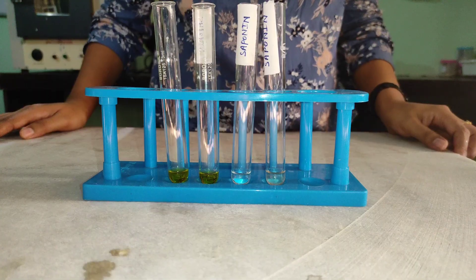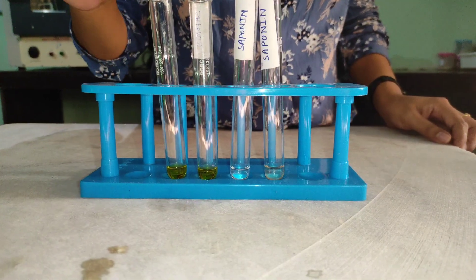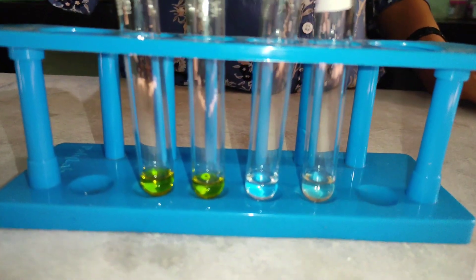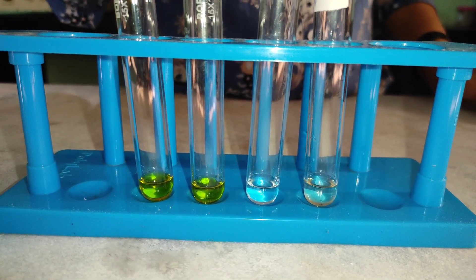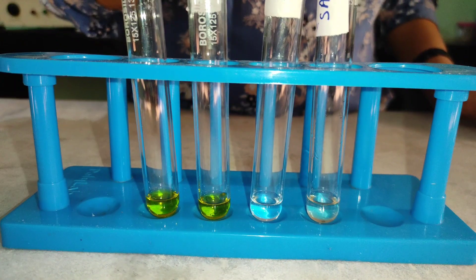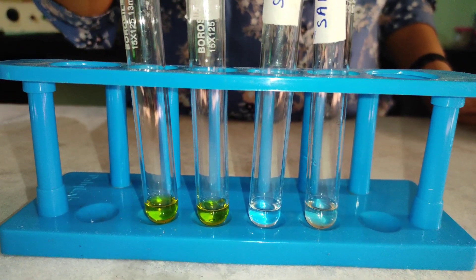We will see how to detect the presence of saponin experimentally. For the saponin test, we have four different plant extracts of different plant parts. We have taken one ml each of the plant extracts, and we will be adding one ml of distilled water to each.